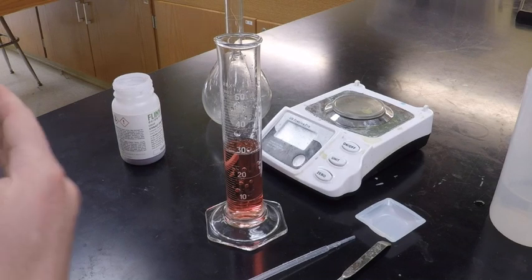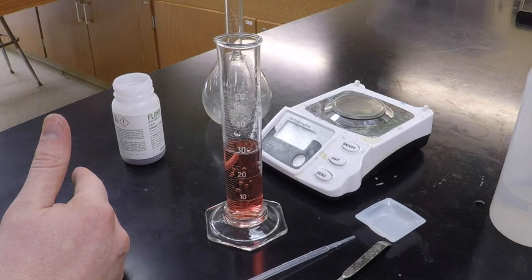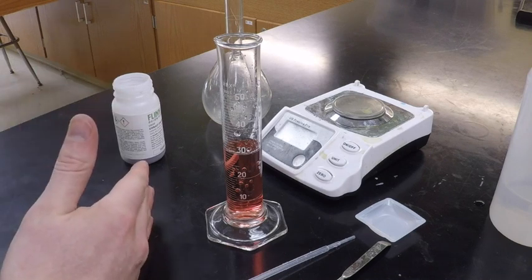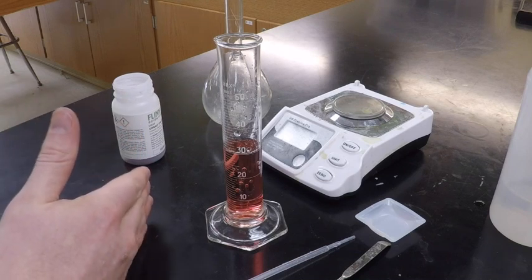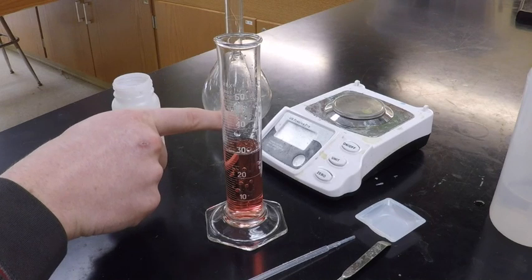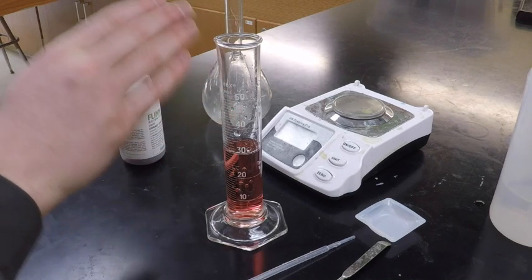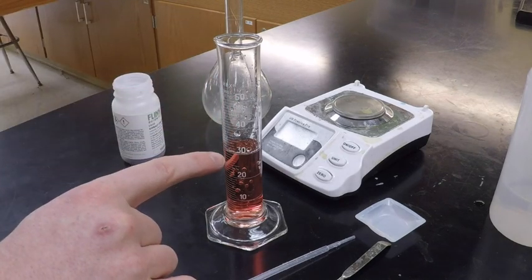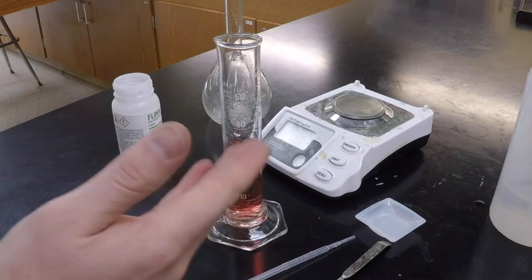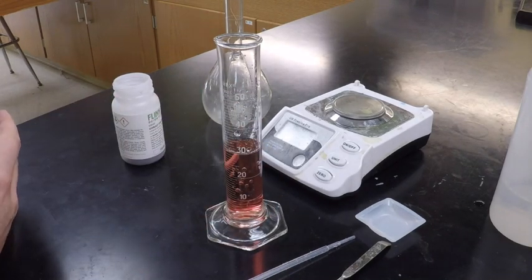Okay? So again, how we make a solution is we do the math first to figure out how many moles we need of our solute. Then once we know our moles of solute, we have to change that to grams because scales can't measure moles of solute, but they can measure grams of something. Then we measure out that amount of grams on our scale, we put it in our container, and we dilute, we add water to the volume that we did our calculation for.